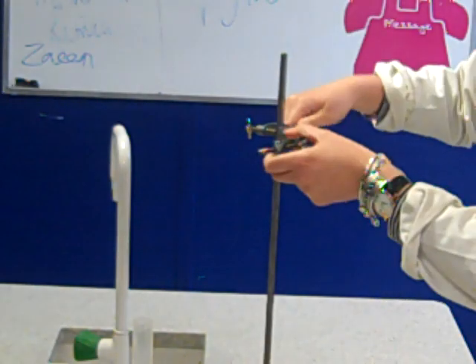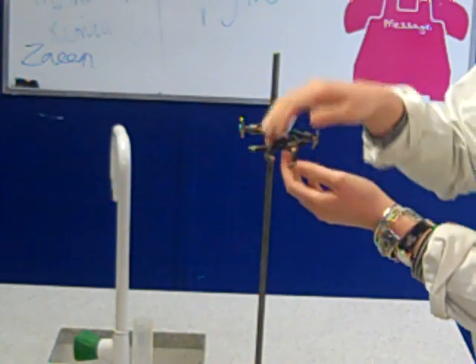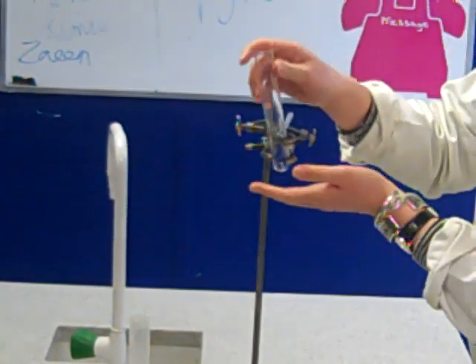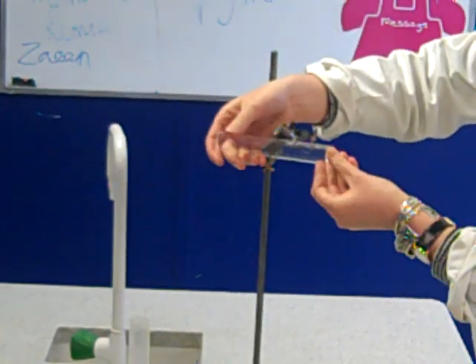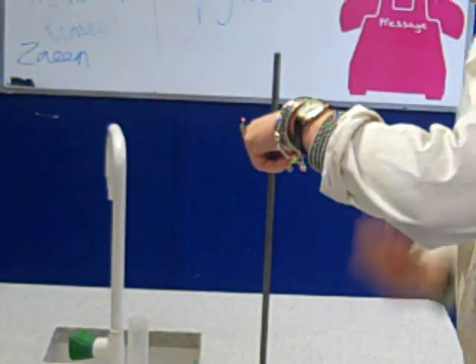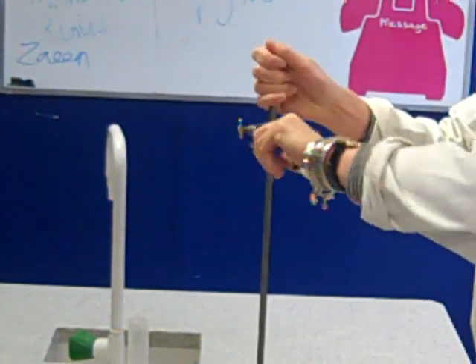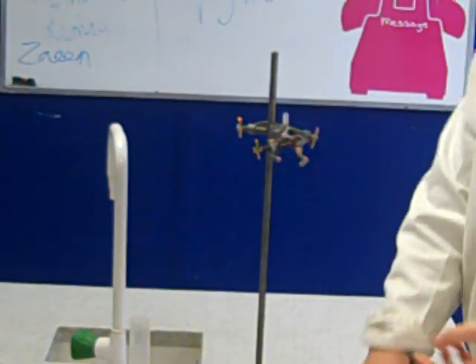Be careful that you're making sure that the clamp is facing the right way up because obviously we need to stick our boiling tube in there. It's not going to be much use to us if it's on its side because all the water will come out. It'll be the wrong way around. So make sure that that clamp is going to hold our boiling tube vertically to our clamp stand.